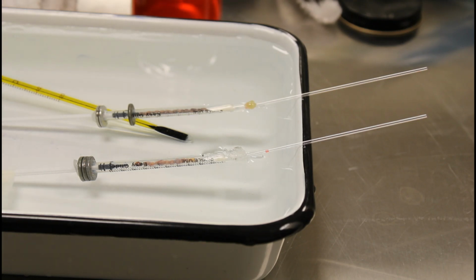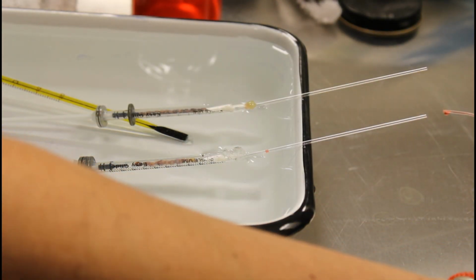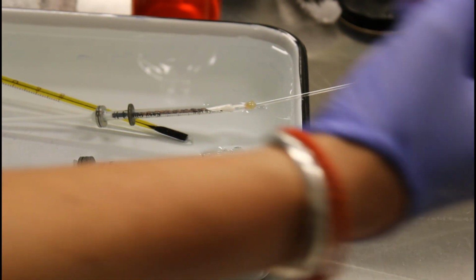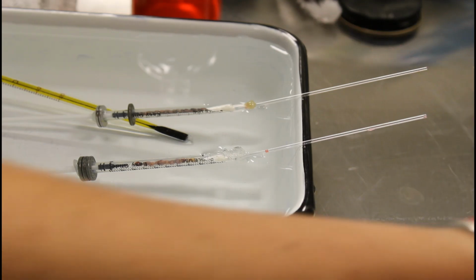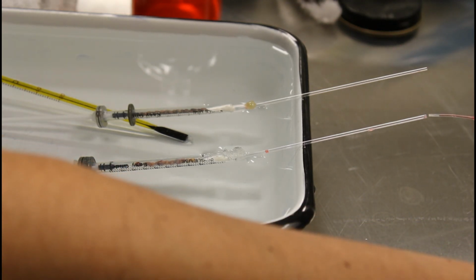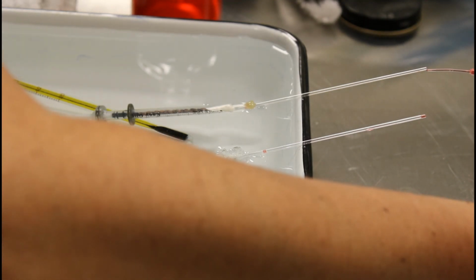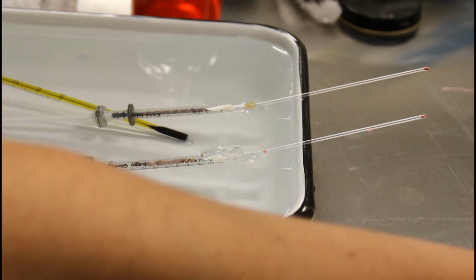So I'm going to put this manometer fluid, it's the same red fluid that we originally put inside these capillary tubes. I'm going to put a drop of them inside both, right at the end of both of these capillary tubes.